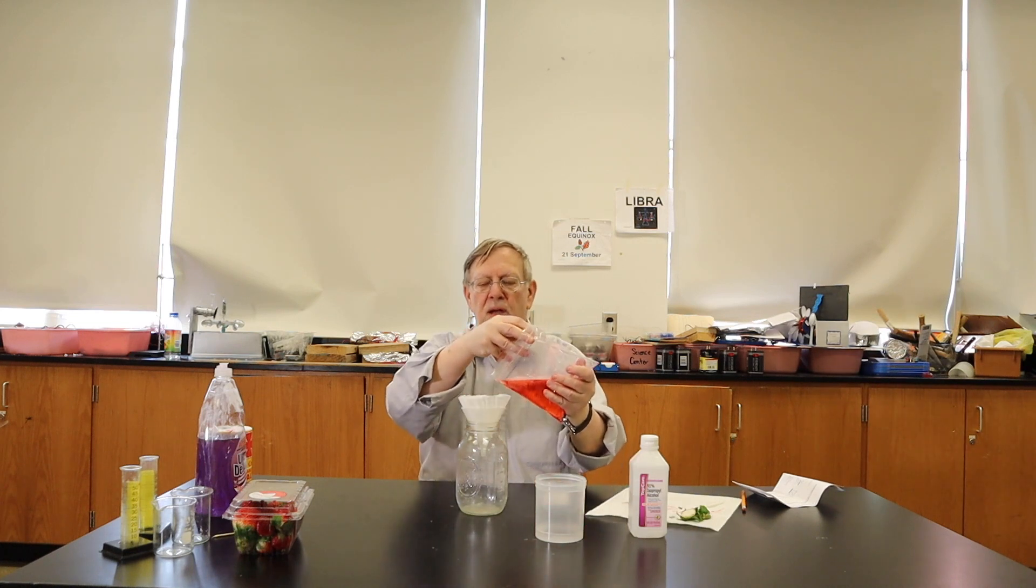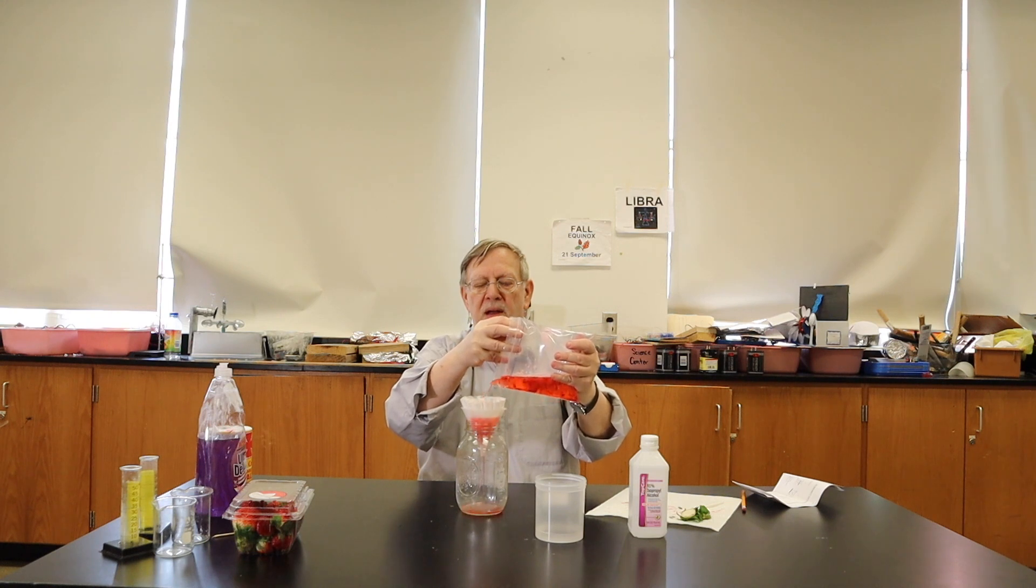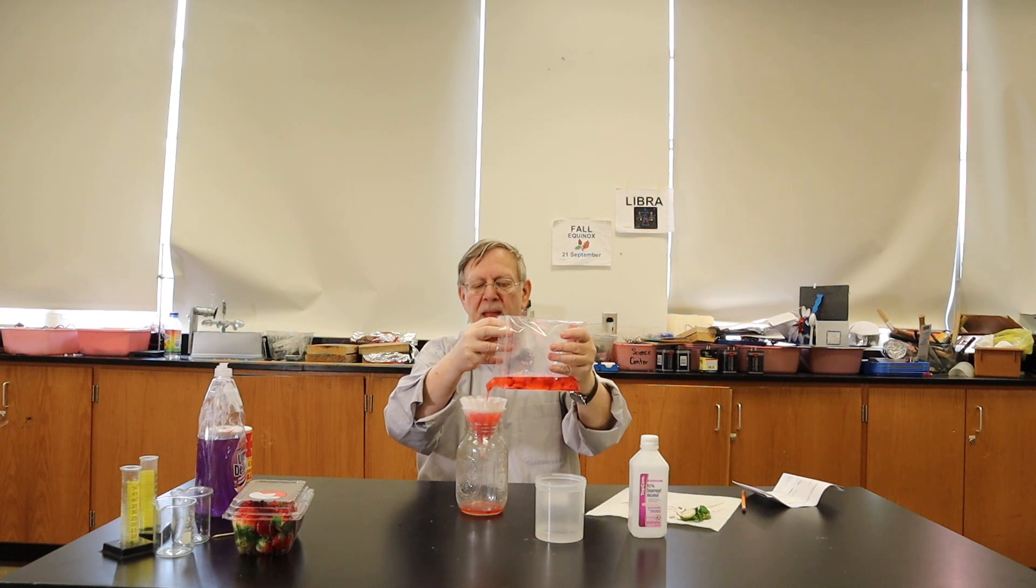And now we are going to pour all of this in. The liquid will go through the filter paper. And the solid material will be caught.